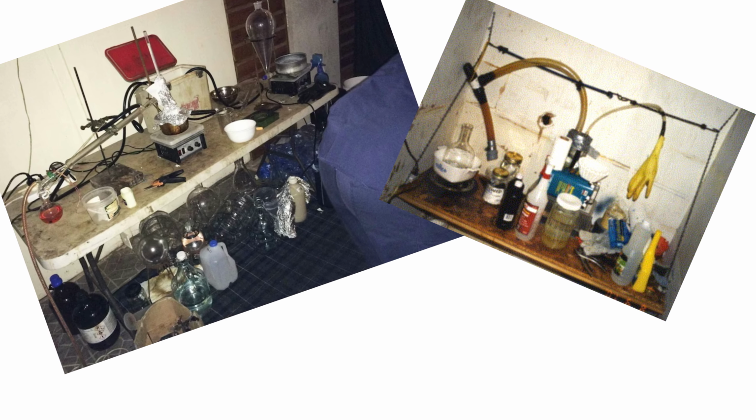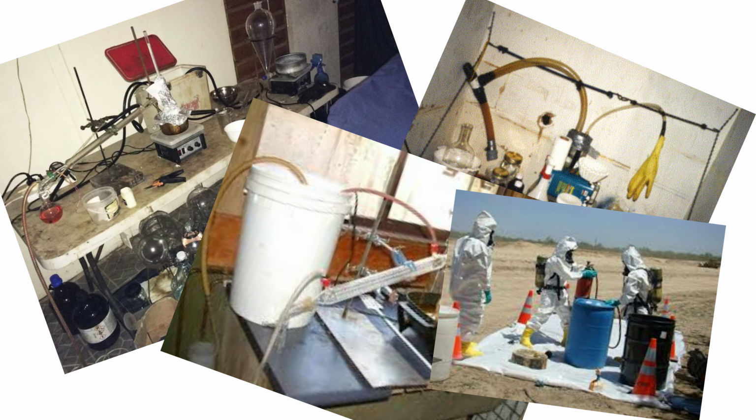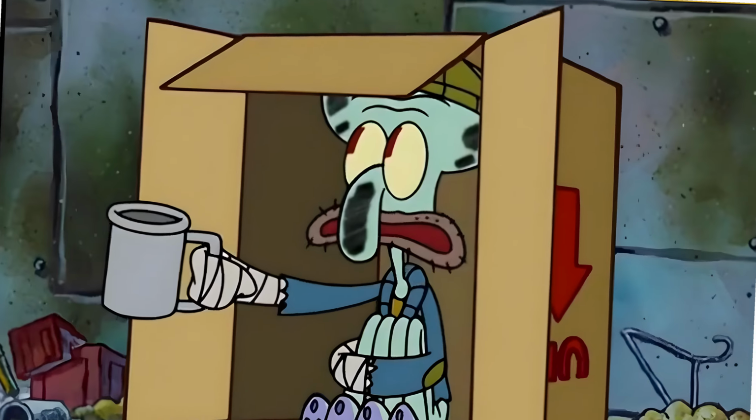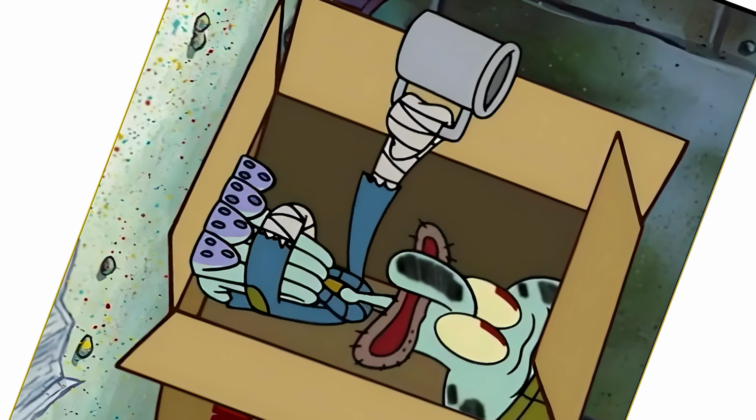Being a homemade chemist is fun. You can do a lot of things with simple material, but it is quite an expensive hobby if you're not rich. Getting or synthesizing the chemicals is the most fun part. You can get chemical products from almost everywhere.